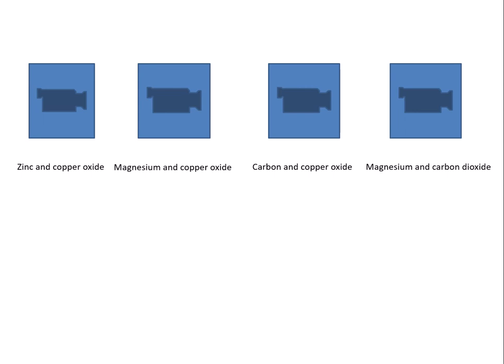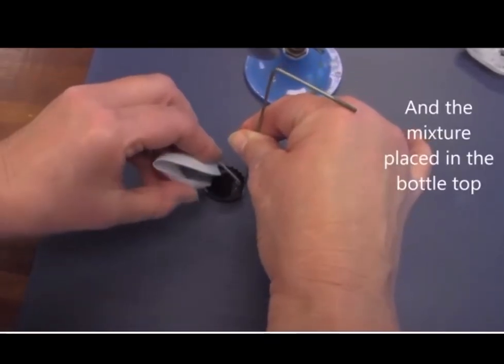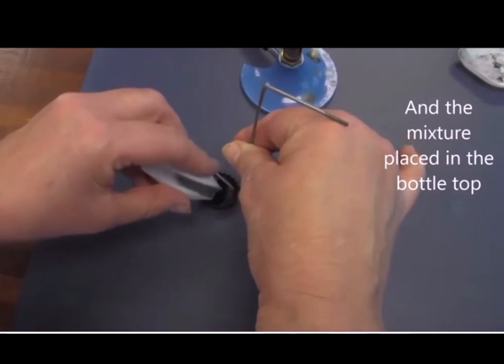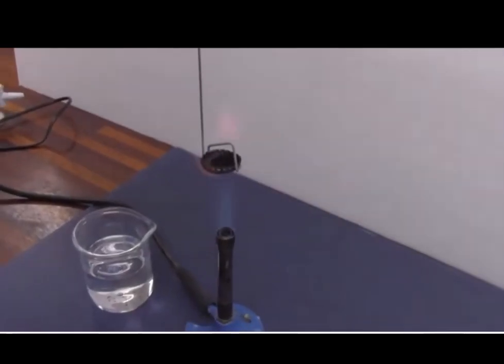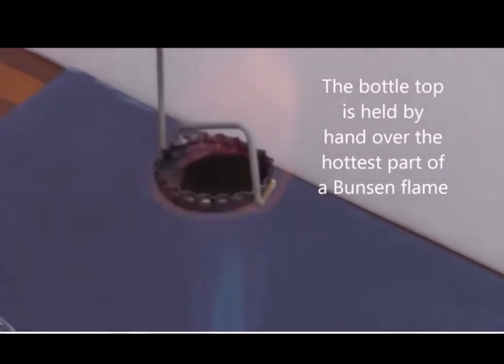Now, the other two that we'll look at are to put carbon onto the reactivity series. So we're going to first of all see where carbon is compared to copper. So we're mixing carbon and copper oxide. Now carbon is a black solid, copper oxide is a black solid. So you'll see a mixture of two black solids being put onto this little bottle lid. And then in a moment they will demonstrate this being put into a Bunsen flame, and then we should be able to see a reaction take place.